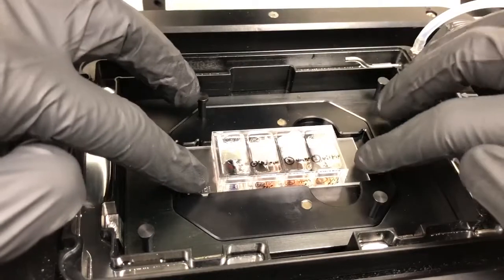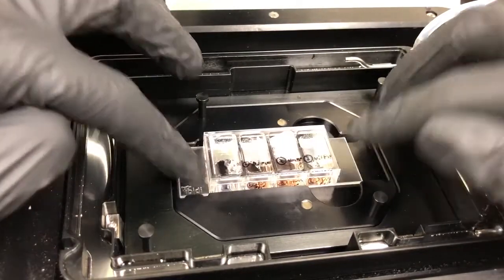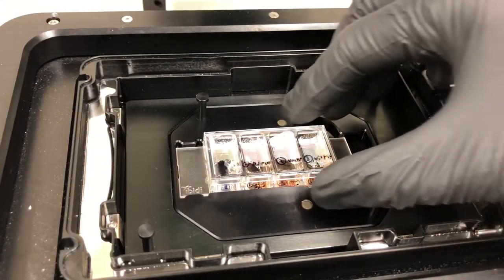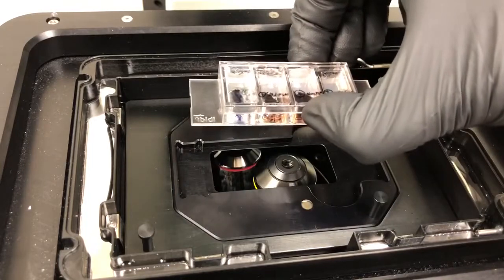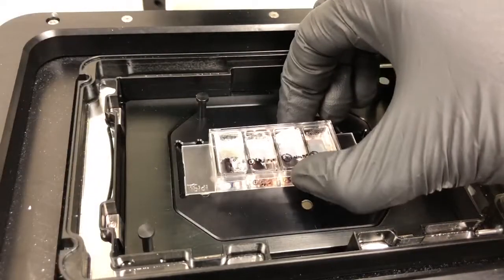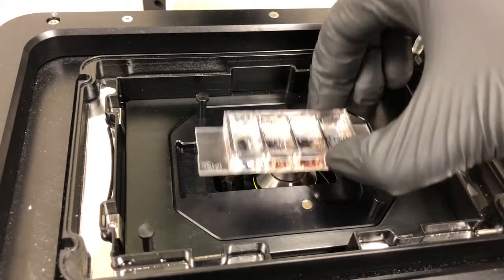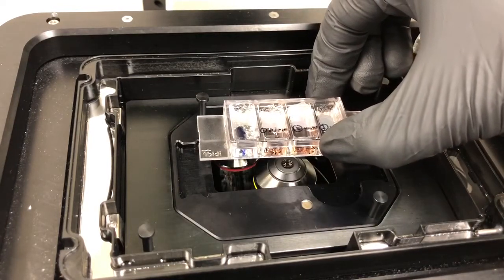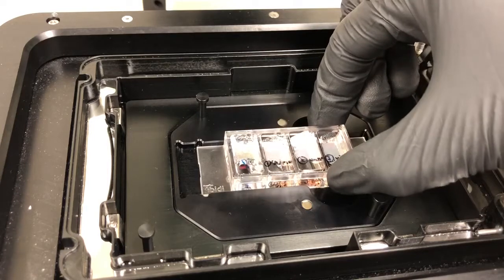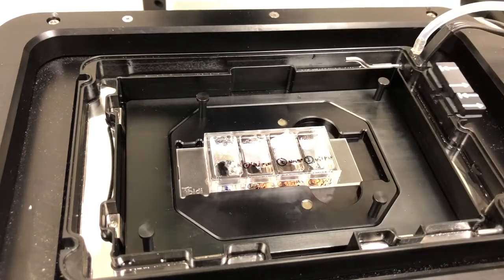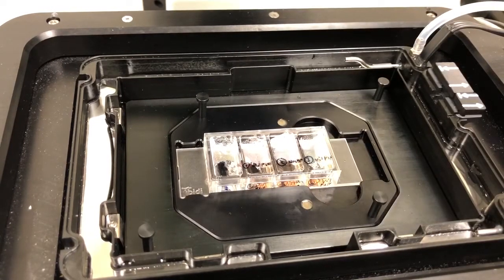I'm just going to put this here and arrange it so that most of the sample fits in most of that gap. If we did this we would be wasting this side. You can see that wouldn't be properly aligned with the hole in which the objective can move, whereas if we push it to the left, that's the proper arrangement for this sample.